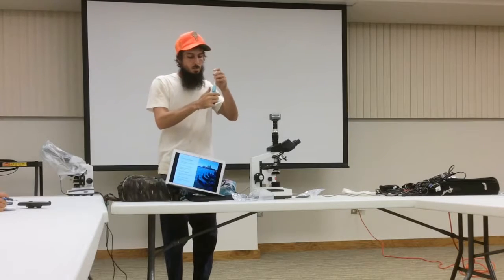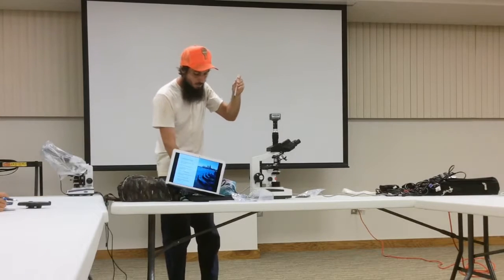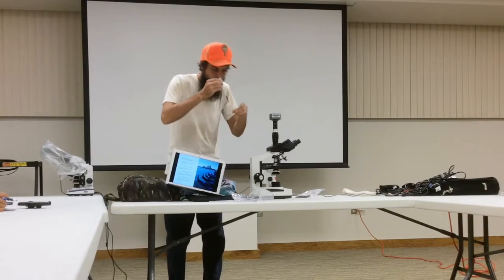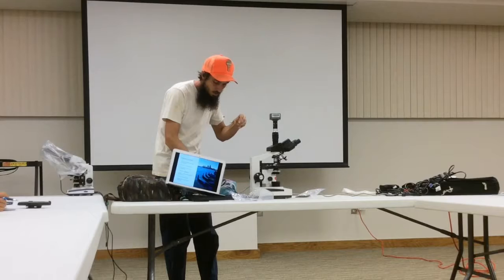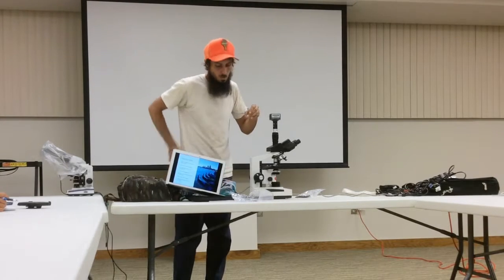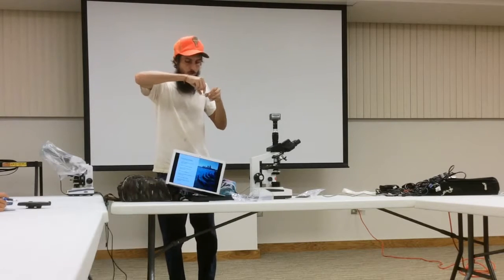And then once I'm satisfied with that, I take just a drop. Drop that onto my slide. And you can do either 1 or 2 drops, depending, just be consistent with it. And then take my cover slip and put that on the top.